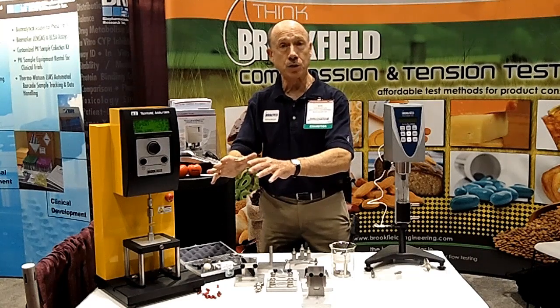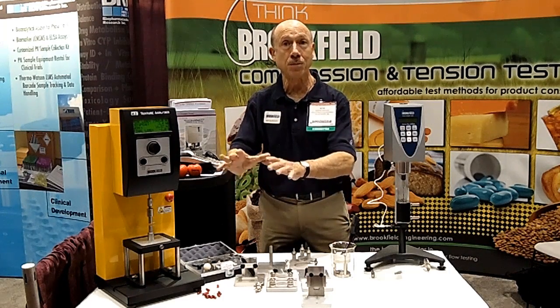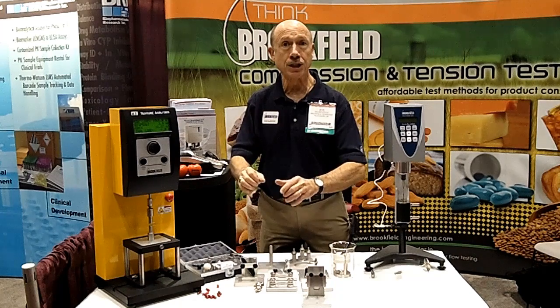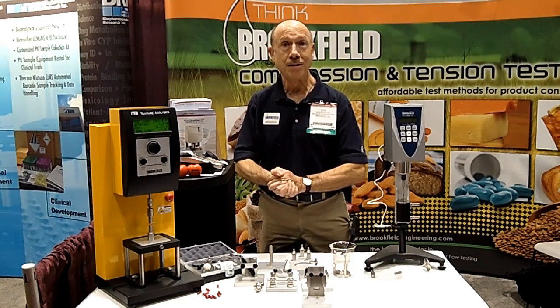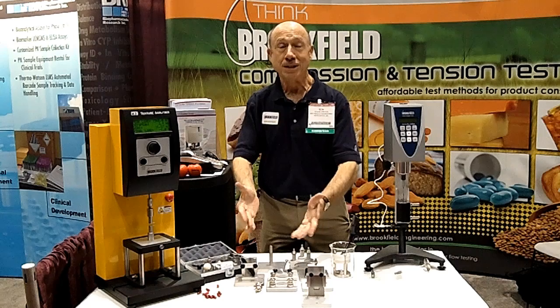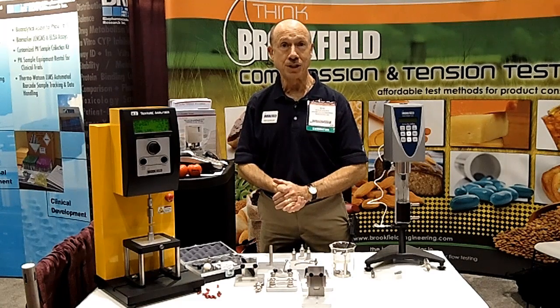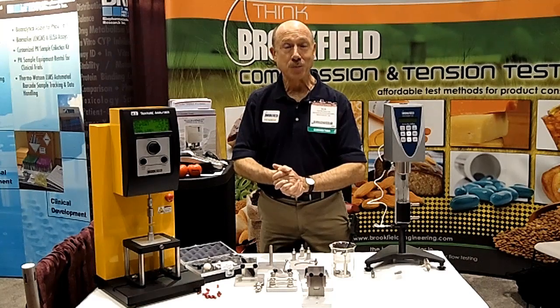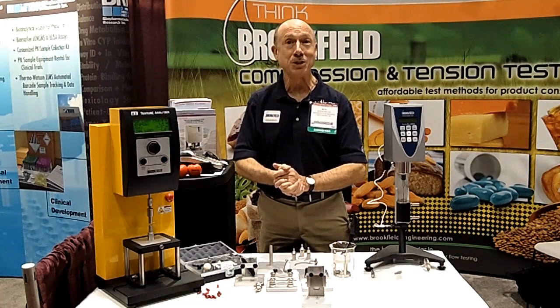This can be used by quality control people running tests on capsules to make sure they meet the company's specification for how much durability the capsule should have. Without these types of tools, the pharma industry cannot perform the relevant quality control tests on items that they produce on a day-in, day-out basis. Thank you, Michelle, for the opportunity to present. Signing off from AAPS here in Chicago.